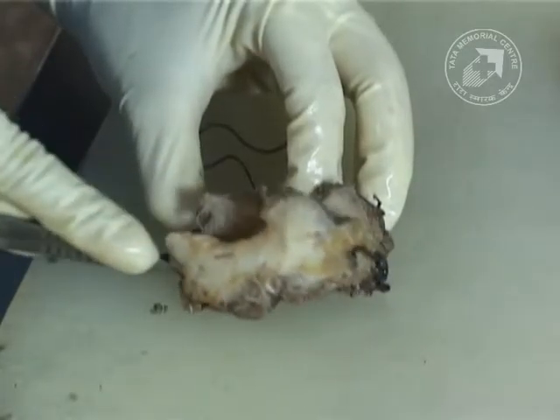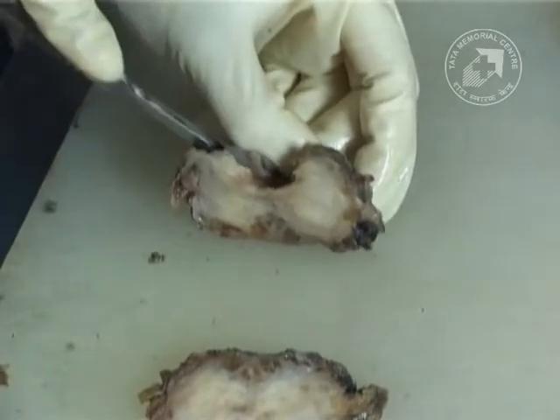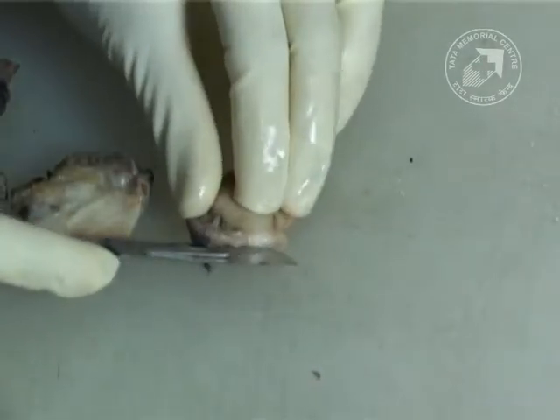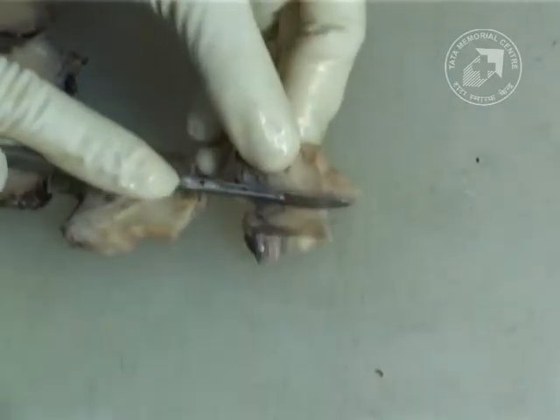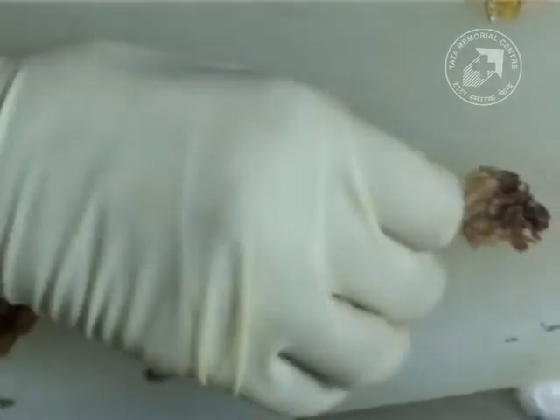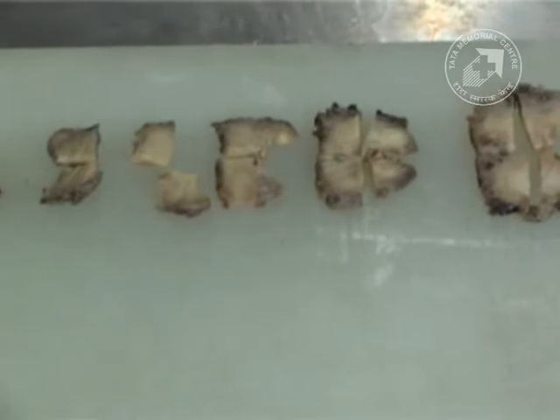Then we go on to completely transect the whole of the prostate, which is similar to the radical prostatectomy. This is the section being taken along with the seminal vesicle of the prostate. The whole of the prostate should be sectioned and taken so as to not miss any concurrent or concomitant prostatic adenocarcinomas. These are the slices from the tumor along with the wall and the fat, and these are the sections from the bladder wall. The smaller sections are the transections of the vas deferens and the ureters, and finally we have the sections of the prostate laid out as for a radical prostatectomy.